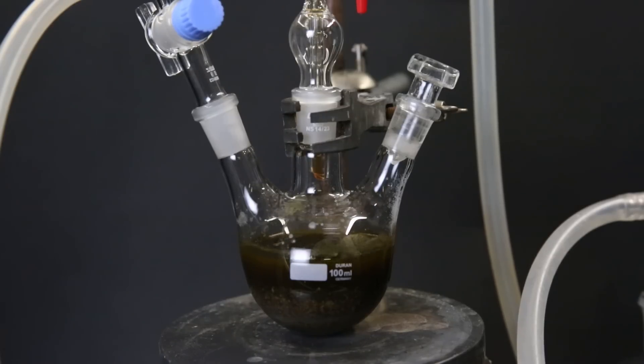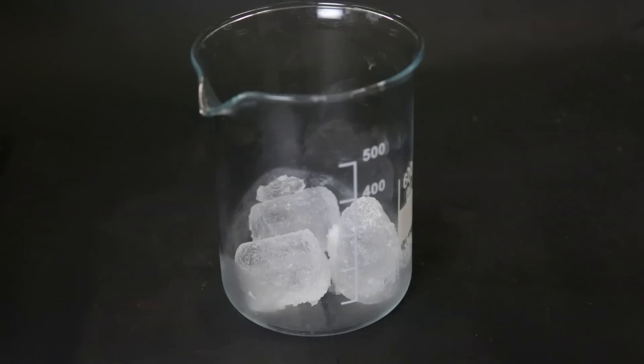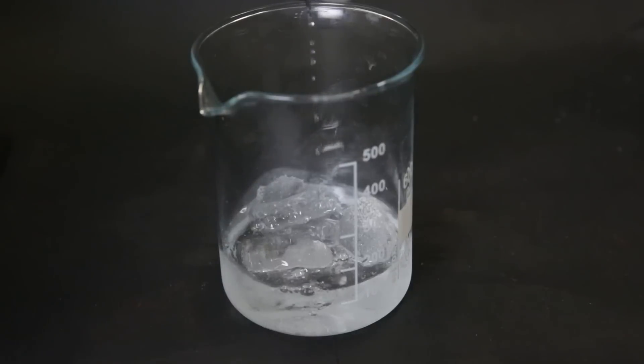So in this case, I will add it to a 37% HCl solution, along with some ice cubes, because the reaction is very exothermic. The present THF and DMSO are both miscible with water, while any KCl and iron salts will simply dissolve in the mixture. Meanwhile, the ferrocene precipitates out and can then be filtered off. So I added about 70 grams of ice to a beaker and approximately 60 milliliters of 37% HCl.